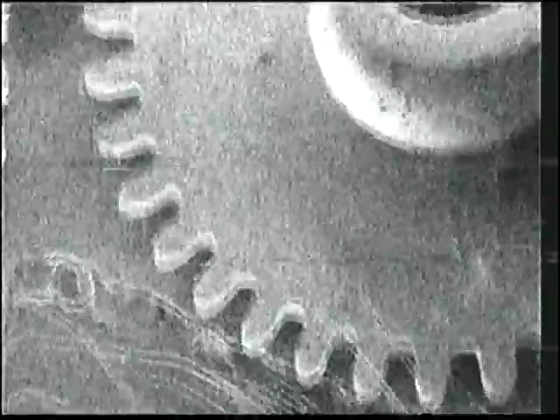Okay, and then the last thing is just simply a pretty small watch gear. I would say it's about a millimeter across. And then we can see how it was stamped out. And some of the structure, I think I can go with a little bit higher condenser lens on that guy. And you can see the imperfections in the stamping of the watch gear as we look along the edges. The lines of the tool, I think, as it got punched out of a piece of metal. Just as a guess, that's what we're looking at. We're pretty confident in saying that. They didn't machine it, they punched it out with a stamp.